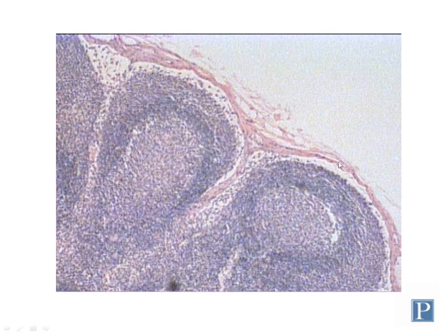Note that the connective tissue capsule extends inward deep into the cortex of the lymph node at various intervals. These inward extensions of the outer capsule are referred to as trabeculae. So here's a trabecula extending into the cortex. You'll notice that there is a space underneath the capsule and surrounding the trabeculae. The space is normally filled with lymphatic fluid that percolates through the lymph node after entering through afferent lymphatic vessels that you can't see on this section.